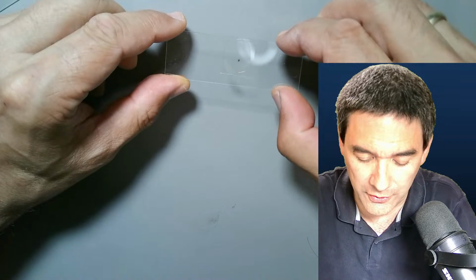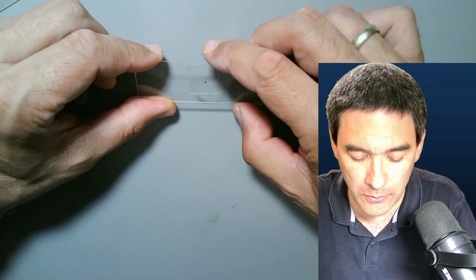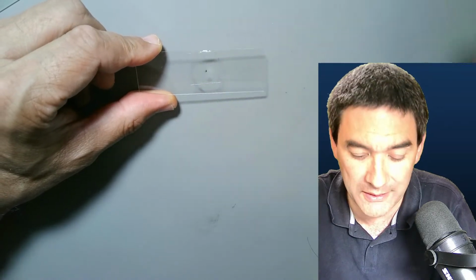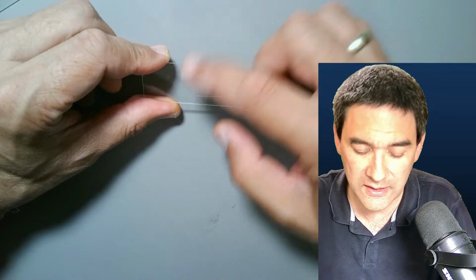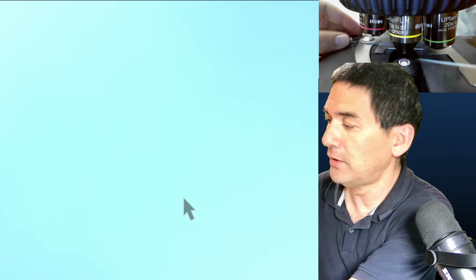Let's drop this on here, and I simply wanted to illustrate a little bit on how this looks like. If you do this, be super careful. If there is too much mounting medium on the side, then the objective might become contaminated with the mounting medium, so be really careful. You only use it as long as it's still wet, only the low power. But I just wanted to show it to you anyway. Scope view, how does this look like?